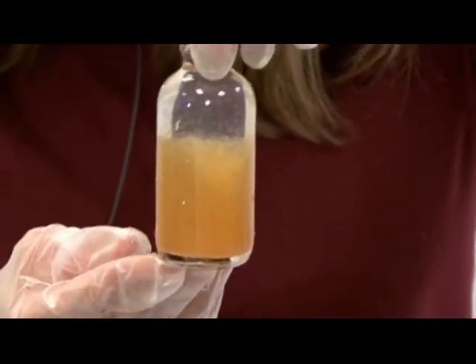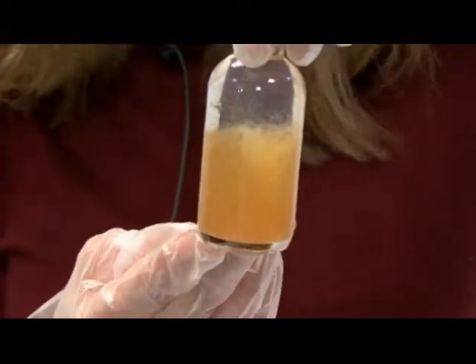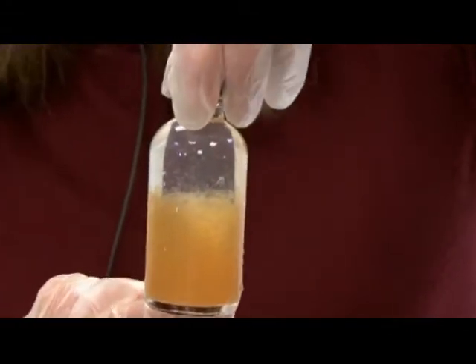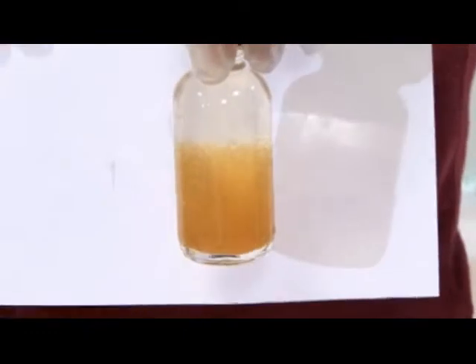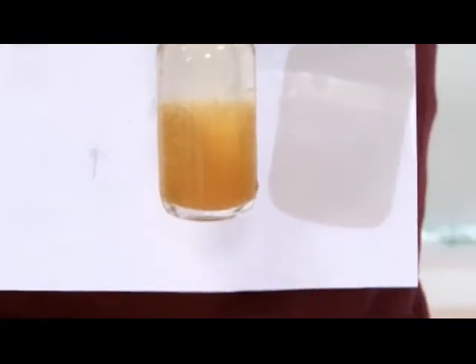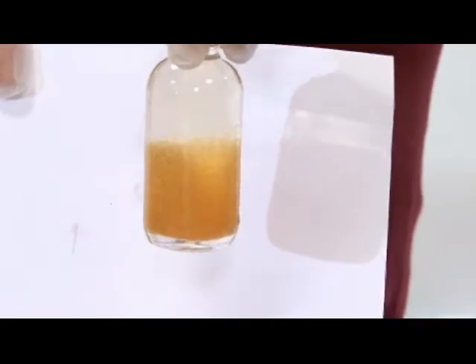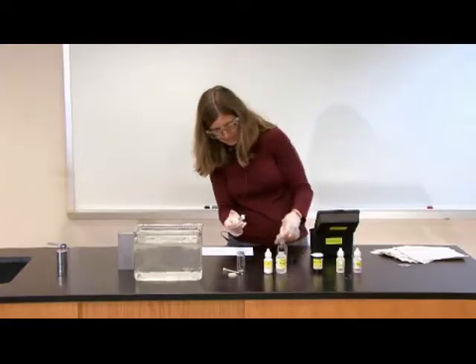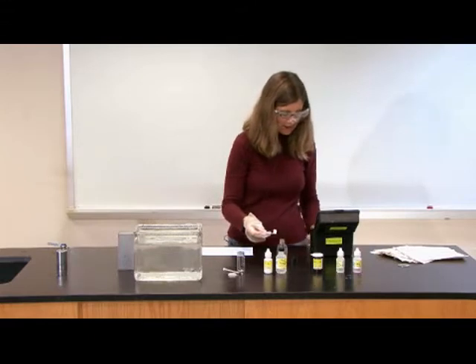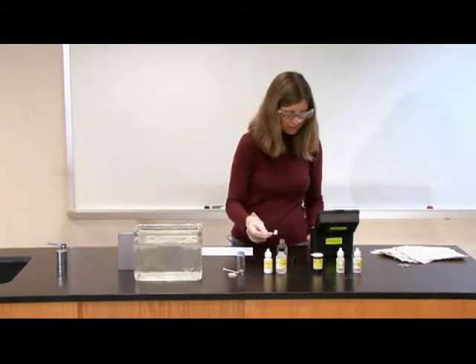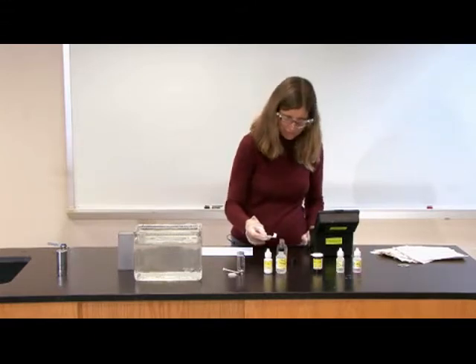So it's probably about one-third of the way down, but I still need to let my precipitate settle a little bit more. You can see that it's clear, fairly clear on top, but still a lot of precipitate on the bottom. Now my precipitate has settled to below the halfway point, so I'm going to go ahead and add my one gram of sulfamic acid powder.